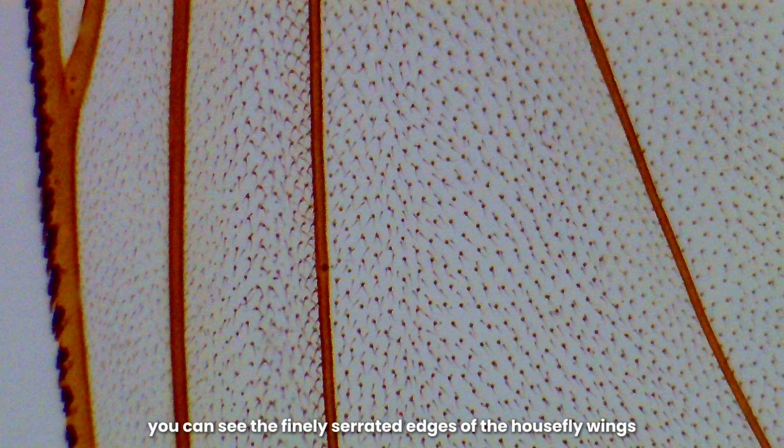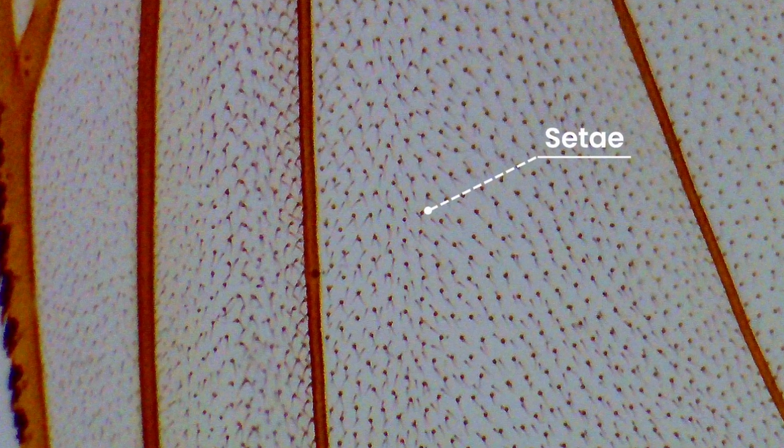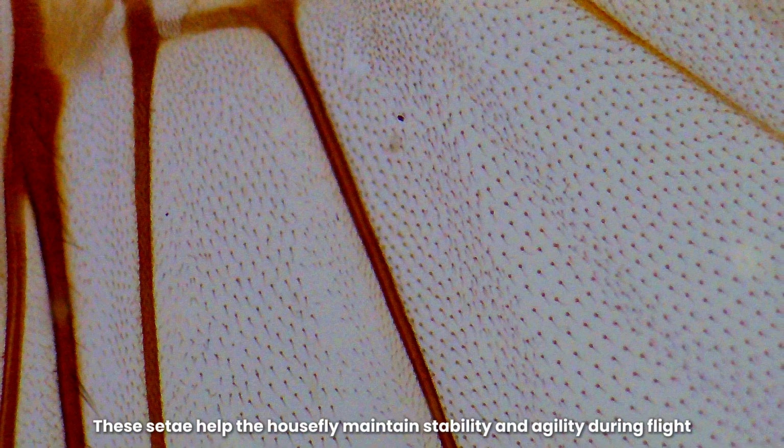When magnified, you can see the finely serrated edges of the housefly wings and tiny black hairs called setae. These setae help the housefly maintain stability and agility during flight.